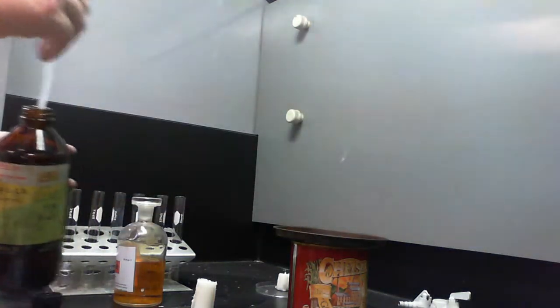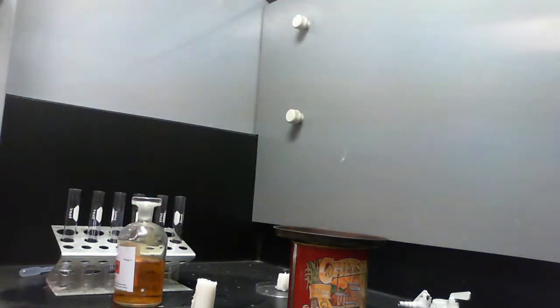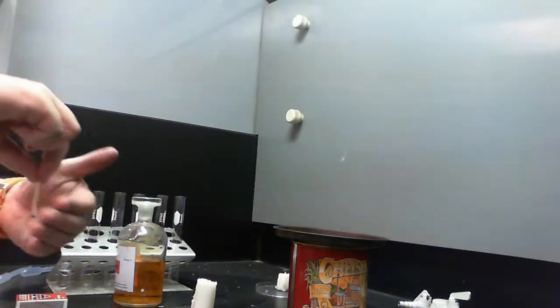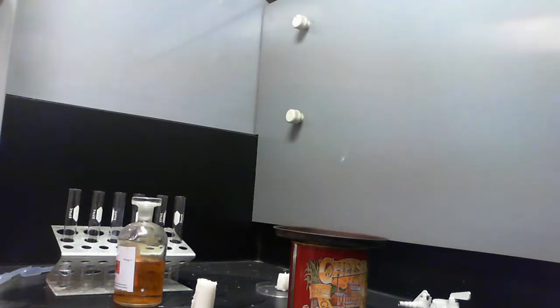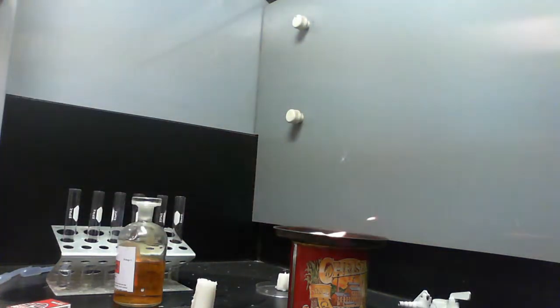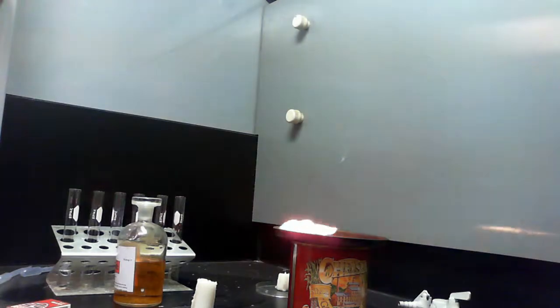I'm not going to put too much on there. You'll hopefully see why I'm being conservative when I light it. With a match that actually is lit. Always the fun thing, trying to light something in a fume cupboard. I didn't even touch the liquid to let that catch, by the way, which is another thing that shows that it's the vapour just sitting above it that's catching fire.